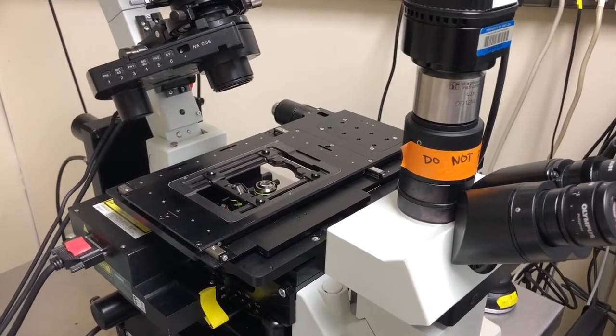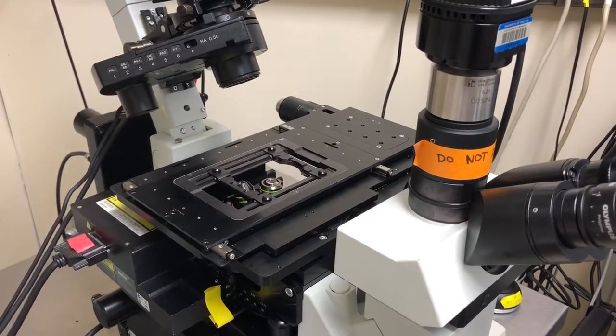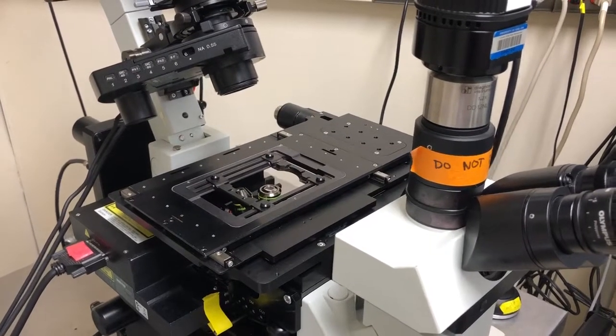This video will show you how to place the 100x oil objective on this microscope, the ix81.